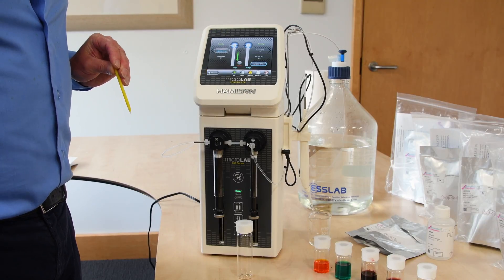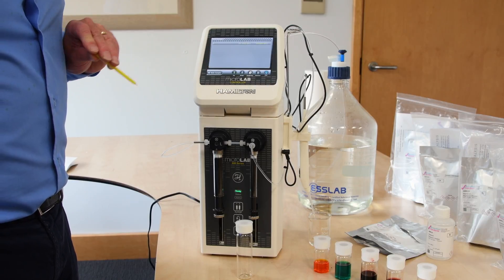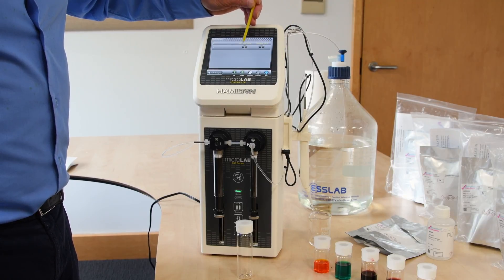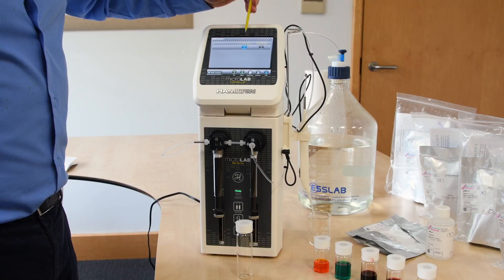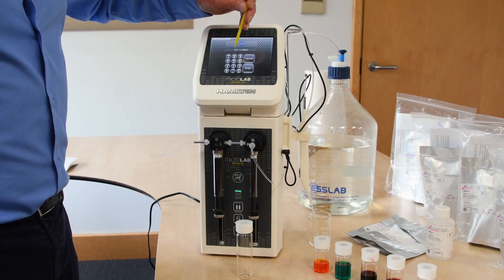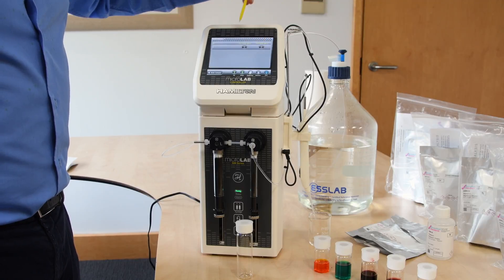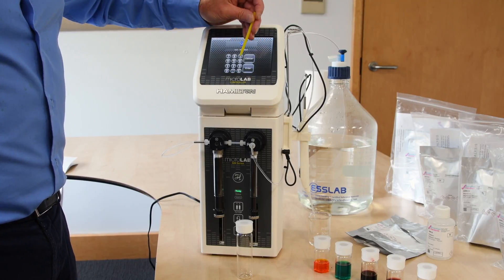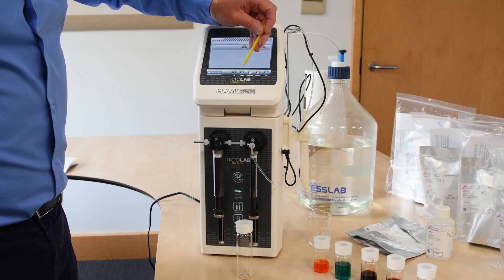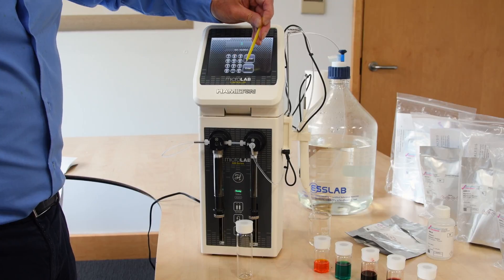I've worked out my dilution profiles for the standards I wish to prepare and will edit the program to put these in by adding a line. We can put an air gap into the system between each sample to ensure separation before materials are dispensed. I'll put in a 5 µL air gap, and the first amount of sample is 625 µL. I'm making a 5-element standard here today.